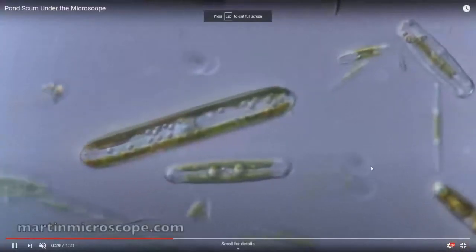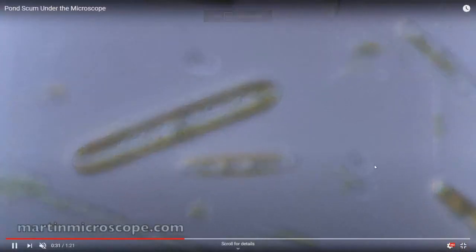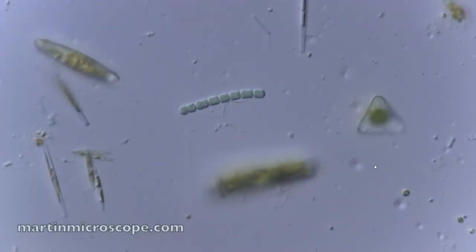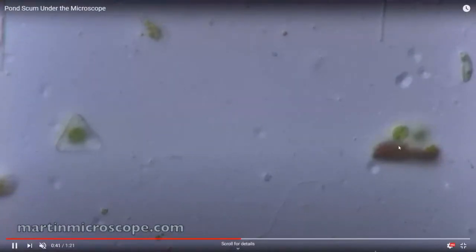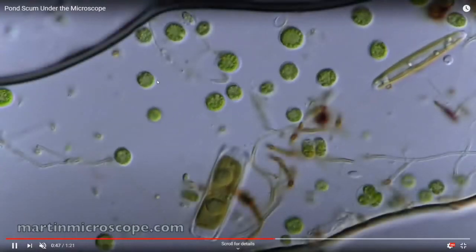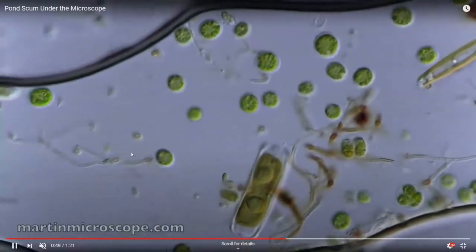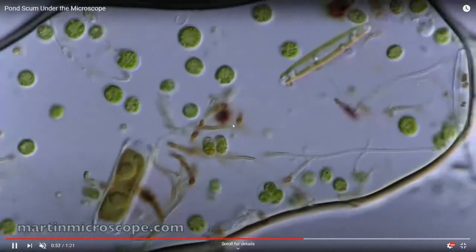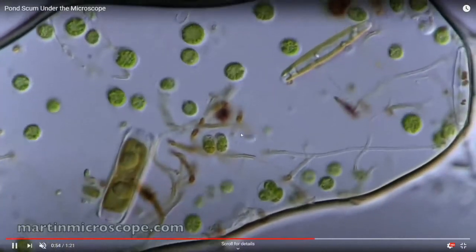So this is just a cool video of a pond sample. This would be something similar to what you might do if you were in a lab — you might take a pond sample from somewhere on campus, put it on a slide and look at it under the microscope, and get to see all the cool little living things inside. So here are some little green cells. These are probably algae, which are what we call photosynthetic eukaryotes.